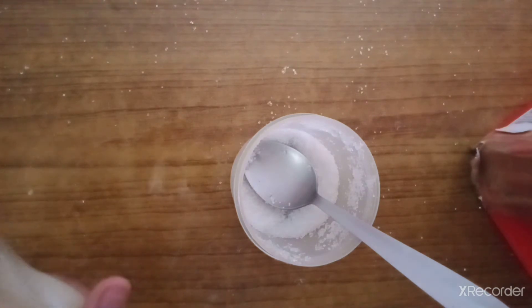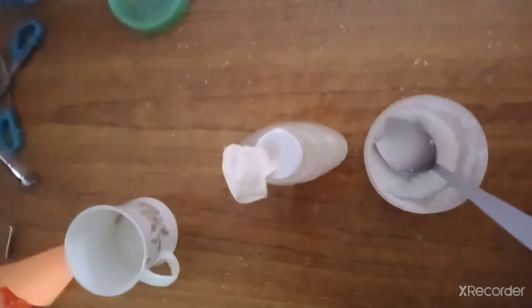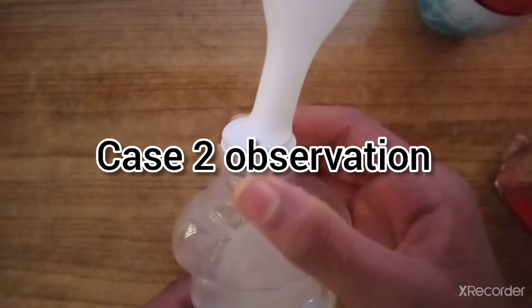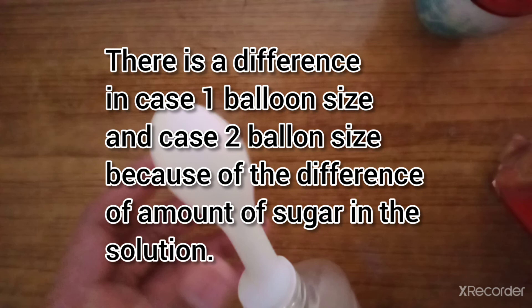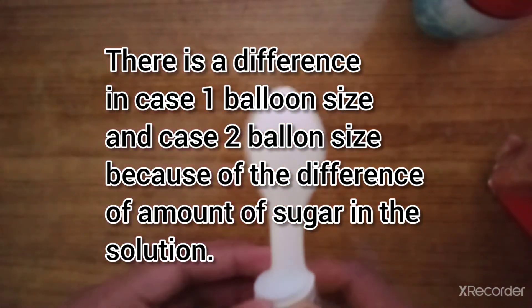I am back after 60 minutes for the Case 2 experiment. We can see that the balloon is much smaller than the balloon from Case 1. Because there is less sucrose, there is less ethanol and less carbon dioxide produced, and thus the balloon is much smaller than in Case 1. Thank you.